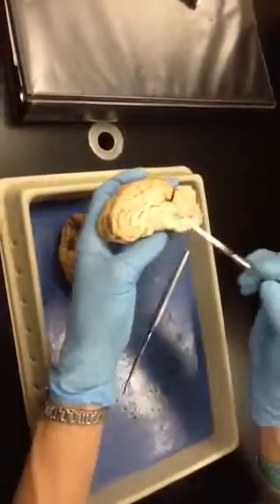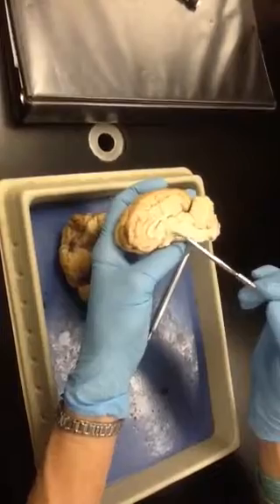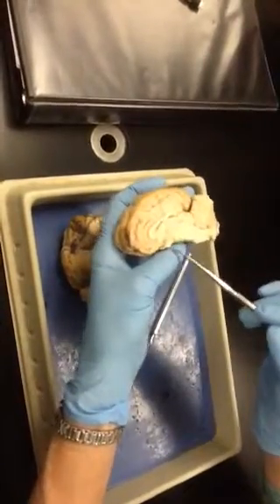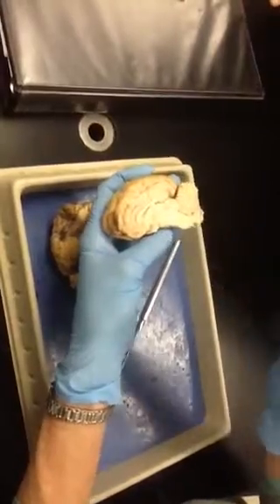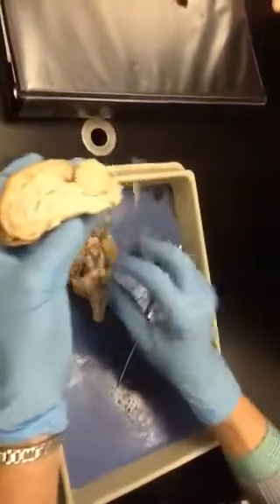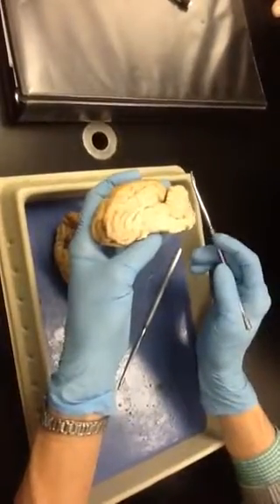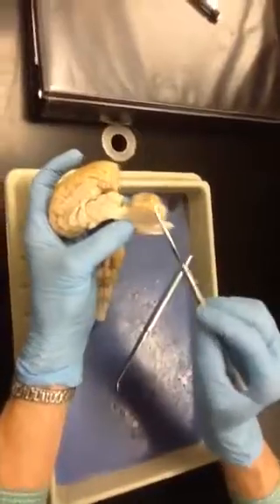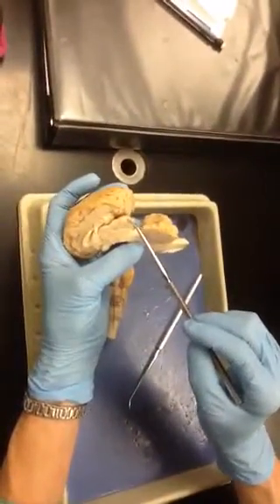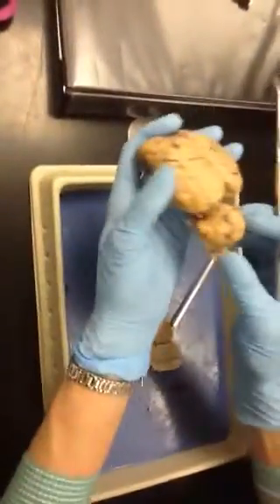Okay? This round area right here is the thalamus. This area just below it here is the hypothalamus. And then if the pituitary were still attached, it would be hanging down here. But the pituitary, when you take that piece of tissue off here, it pulls right off. And then if we pull this down again, we can see here's our butt cheek again, right? Superior colliculi. Did we do that? We didn't do it on that one, though. Okay. Let's just take a look at this one.